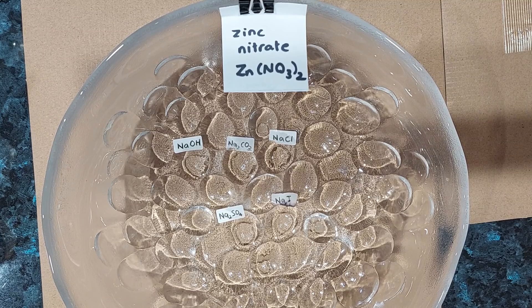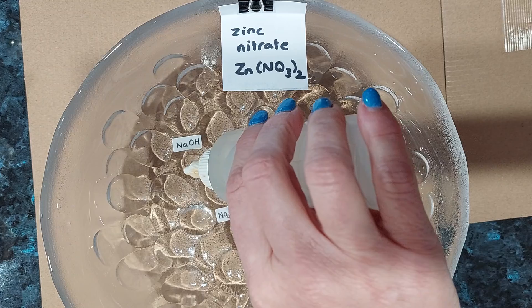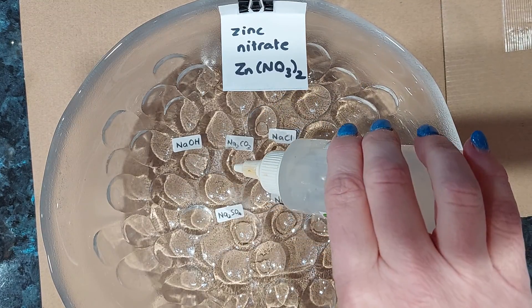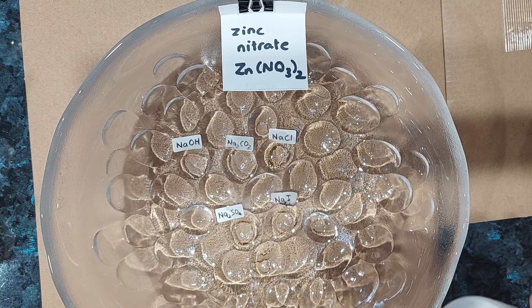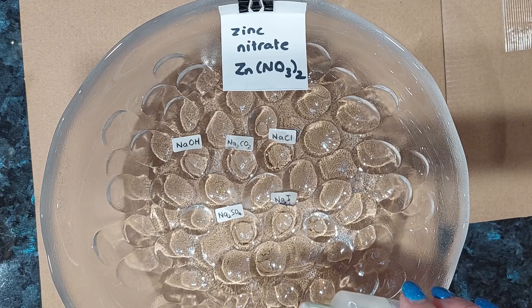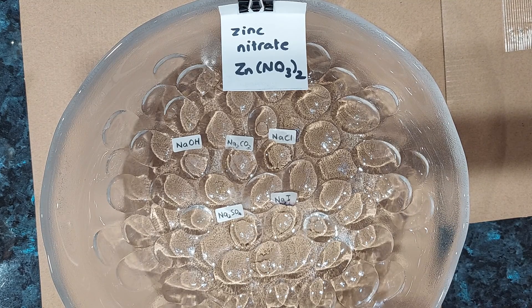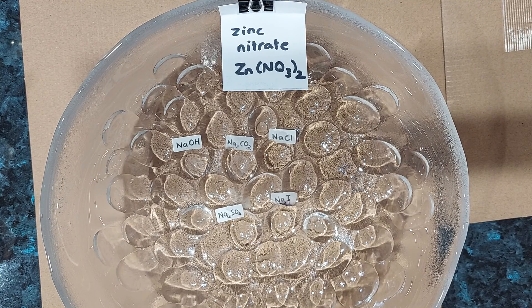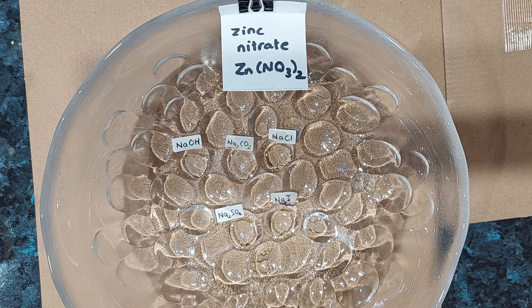Just a couple to go now — it is time for zinc nitrate. Zinc nitrate with sodium hydroxide — nothing much happening there. Sodium carbonate — a very fine precipitate forming, very minimal though. Sodium chloride — nothing. Sodium sulfate — nothing. And sodium iodide — nothing. As time goes on I can actually see the sodium hydroxide gradually forming a fine precipitate as well.